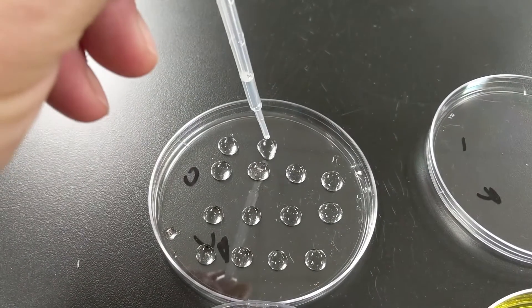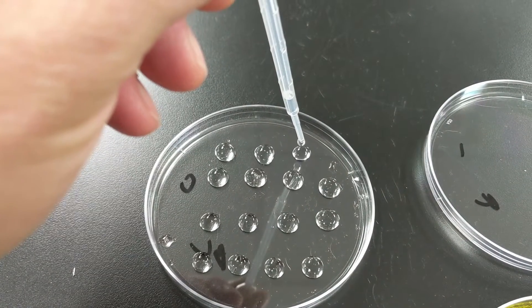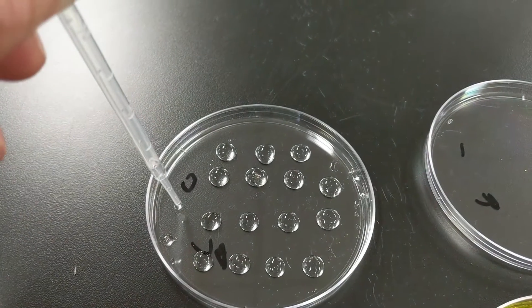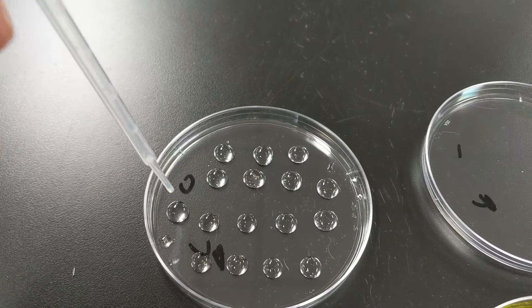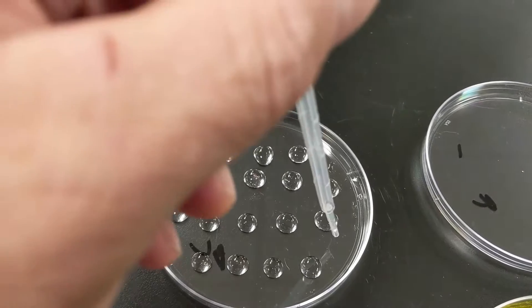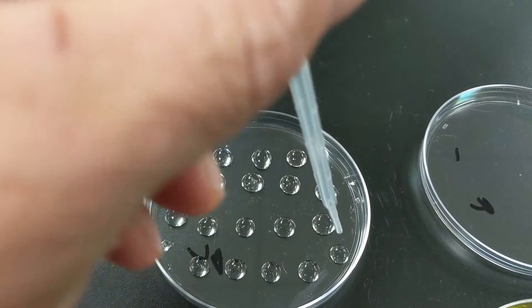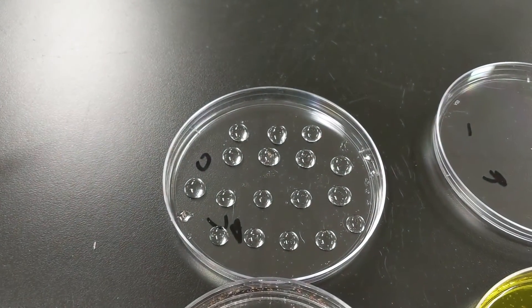Let's empty out the pipette and get all my shrimp. That was supposed to be three. Do I have some room over here? There we go. It looks like I'm going to get one more. So there's how I've plated out.